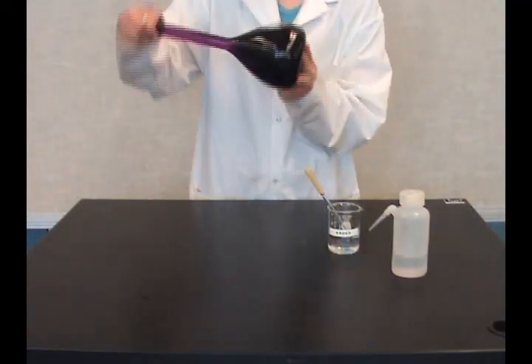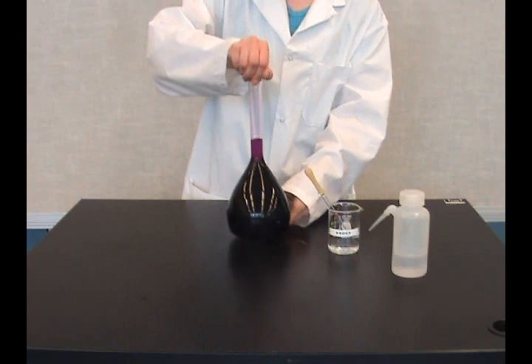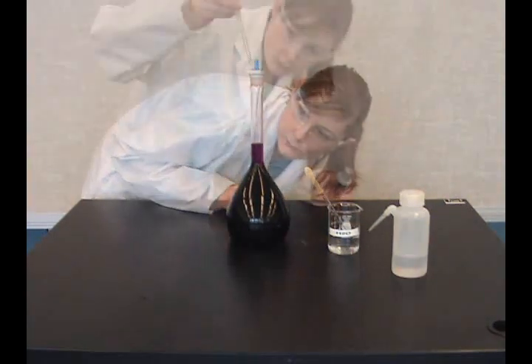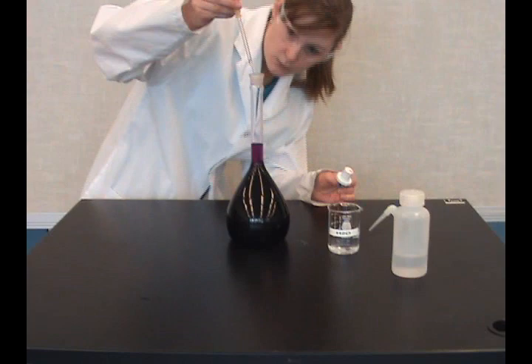Stopper the flask, invert, and swirl. Check the meniscus. If needed, add a few more drops of water.